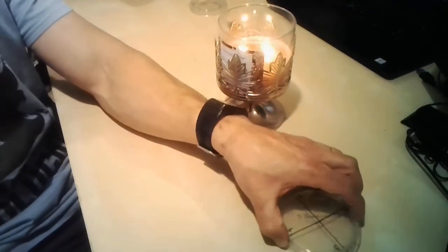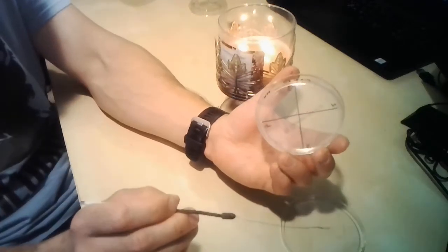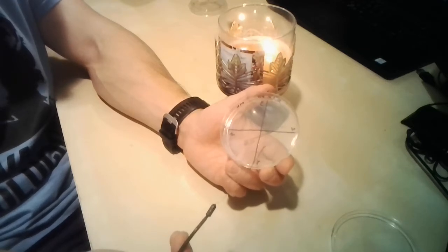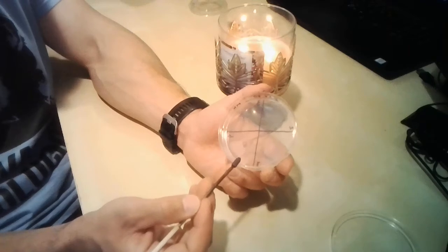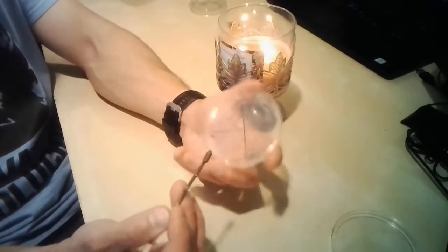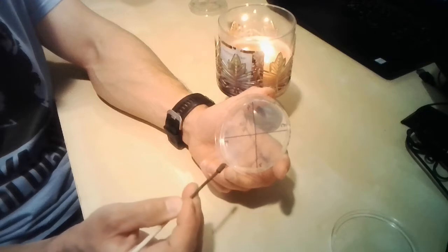Hopefully I spent enough time sterilizing. I'm going to spend enough time cooling. Since it's cooled down, I can sample my fomite and inoculate the third sector.